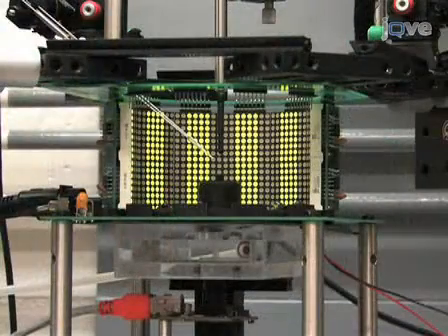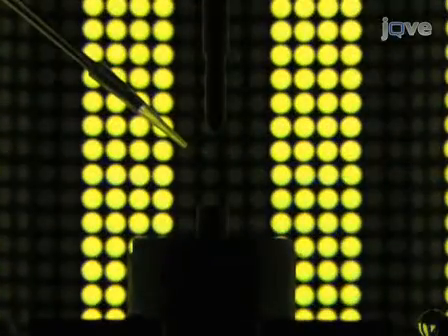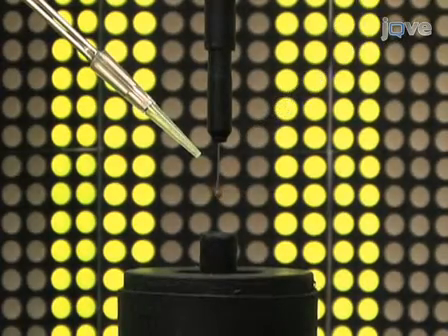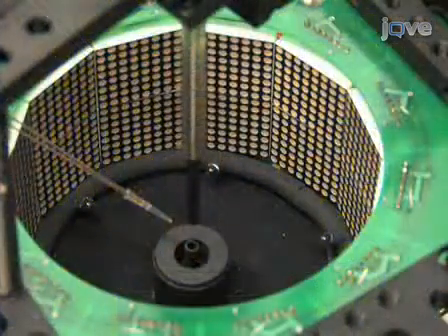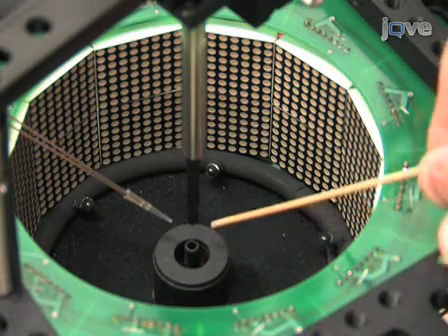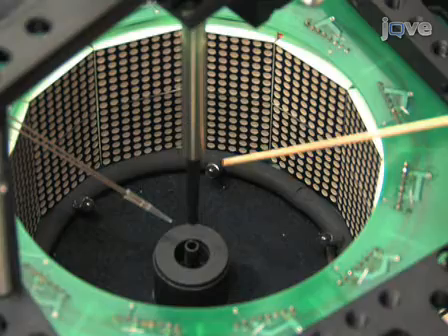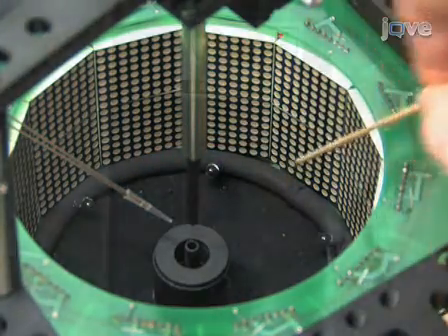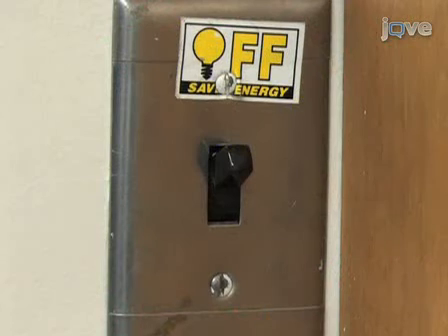To illuminate the fly, use a circular array of infrared LEDs, which are positioned just under the LED panels. Focus each LED on the fly's body individually for uniform illumination. To reduce glare from the panel system and to minimize visual cues observed by the fly, it is useful to coat all reflective surfaces within the camera view with flat black paint. Room lights should be switched off to reduce glare and brightness modulations detectable by the fly's eye.